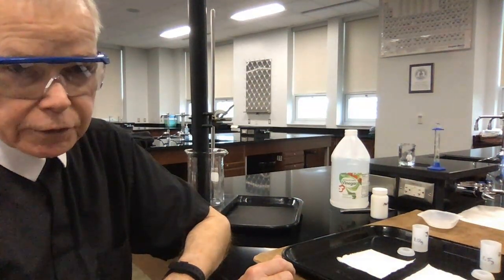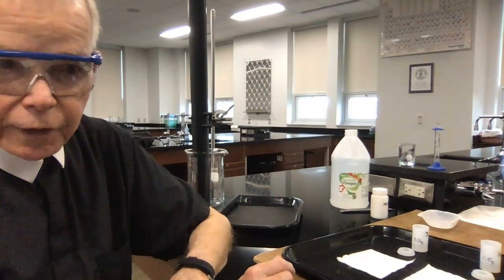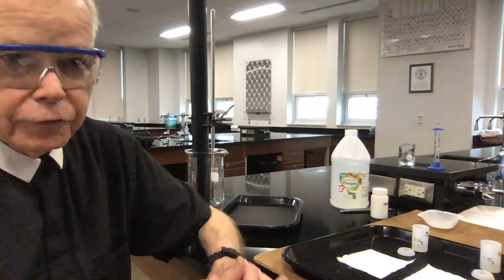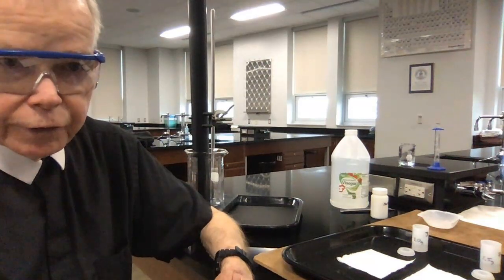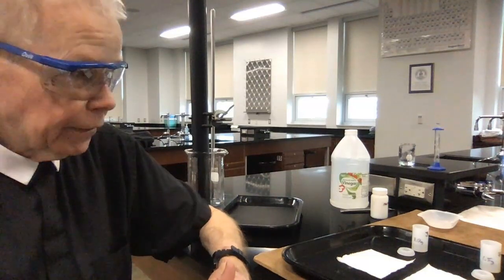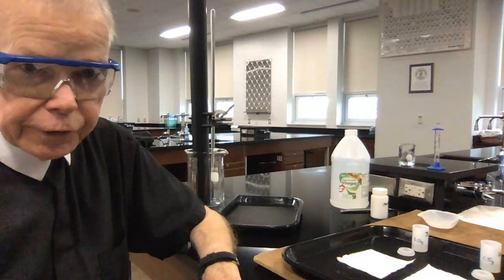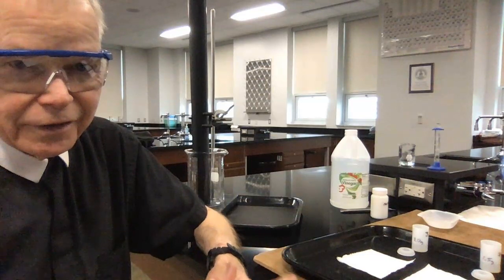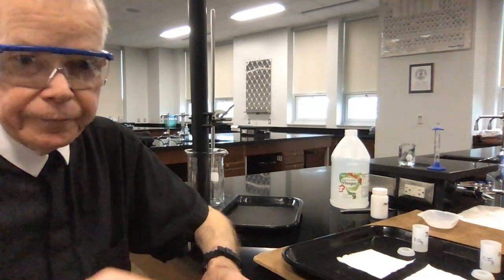And if it reacts, it may launch the little canister for us, and hopefully we'll see something like that. And then what we want to do is compare and see how the amounts of sodium bicarbonate affected how the launching process went. A lot of times when I do this, we get a dud, doesn't work at all. And the little tube here will guide the canister vertically, and I'll try to estimate how high the canister might fly. So I'm going to turn off the video here and get set up outside in the plaza.